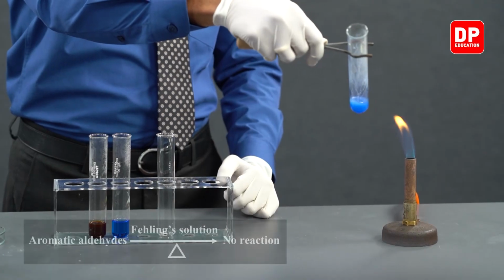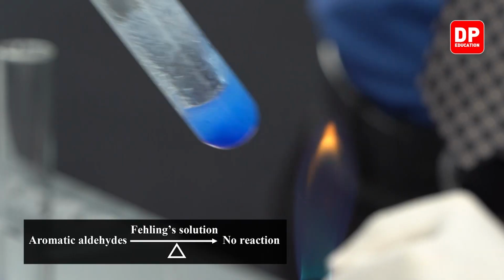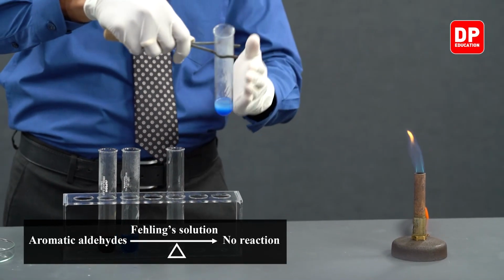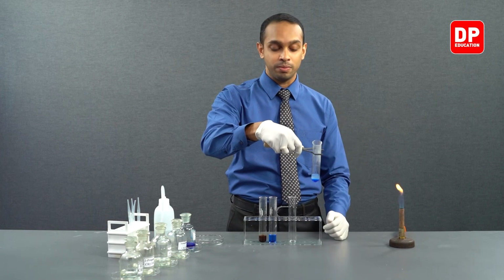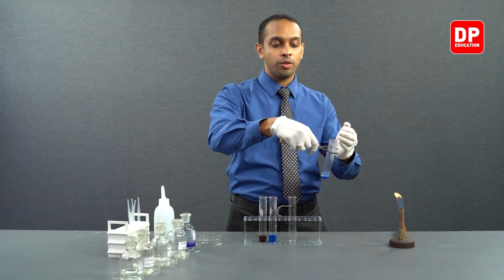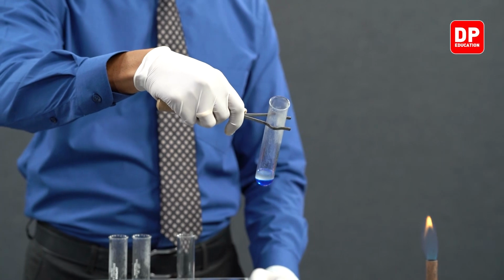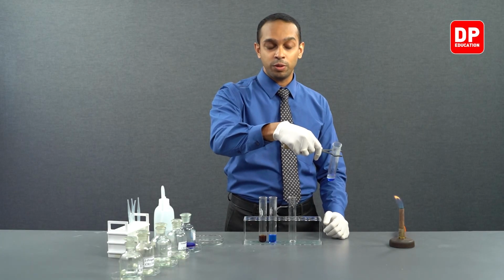As you can see, it boils off, sometimes shoots out as well, so you have to be very careful pointing it away from you. And when you're pointing these things away from you, please make sure not to point it at anyone else as well. Because when this boils off, it might splash out of the opening of the boiling tube, which might result in a burn injury in someone in front of you.